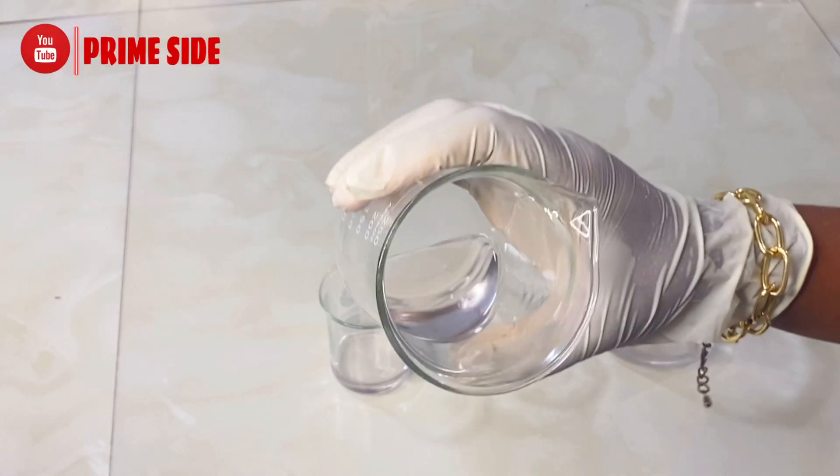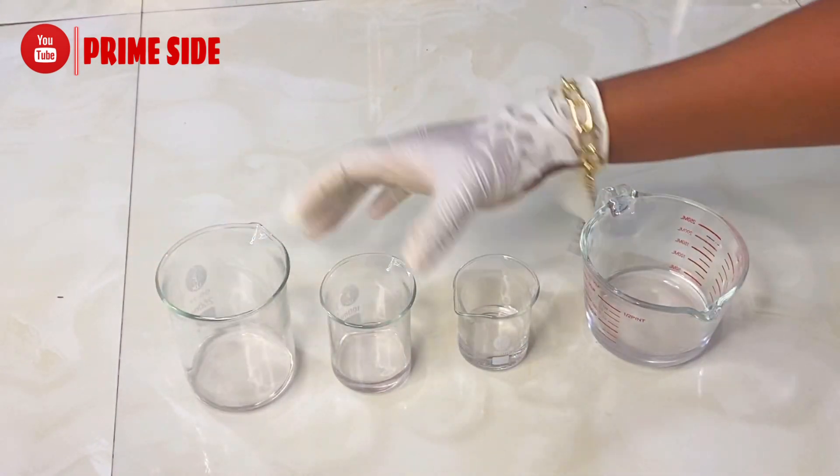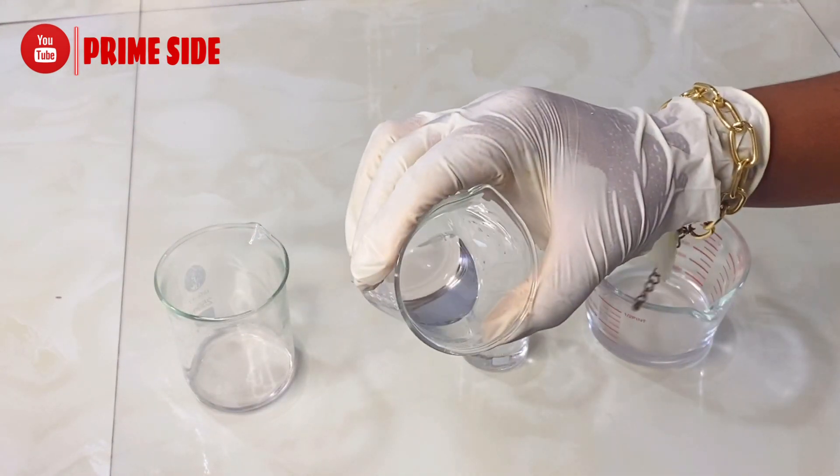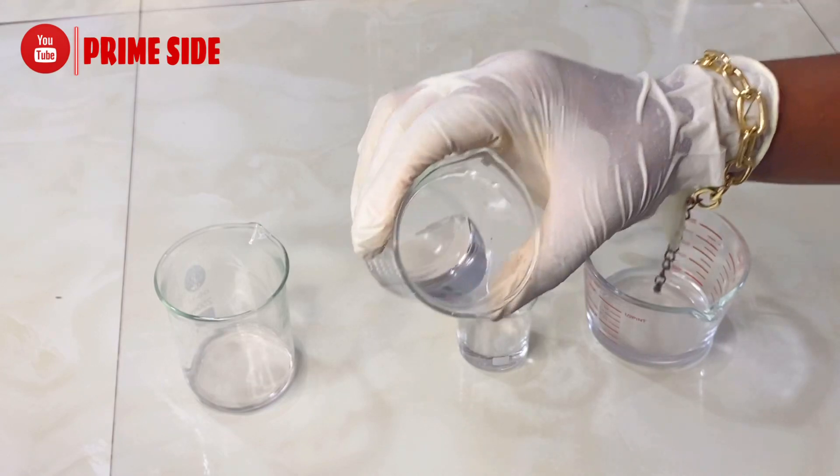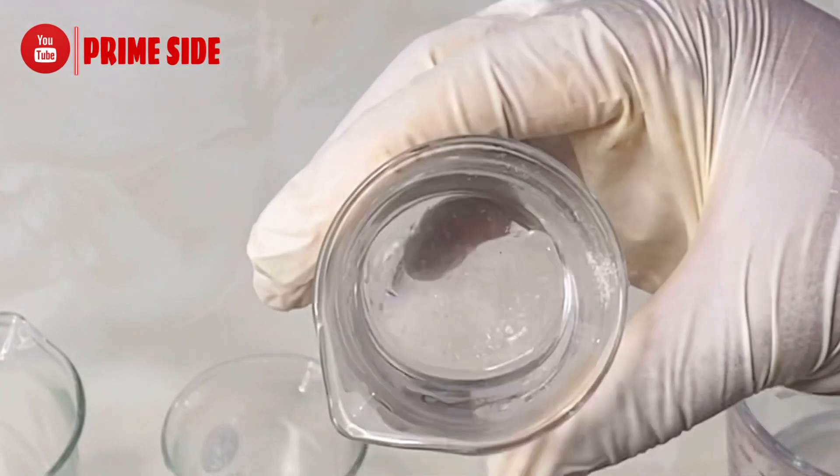I carried out an experiment on salicylic acid because I wanted to know the best solvent to use to dissolve salicylic acid completely, and I also wanted to know how fast a solvent could dissolve salicylic acid.